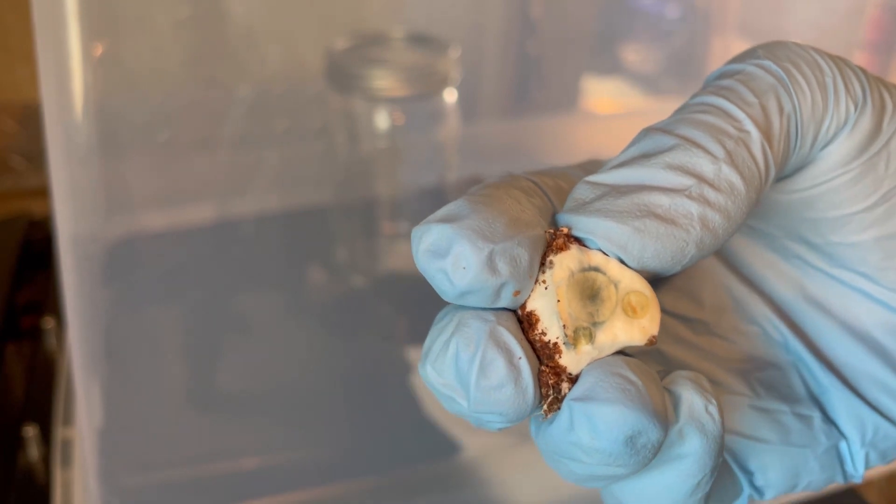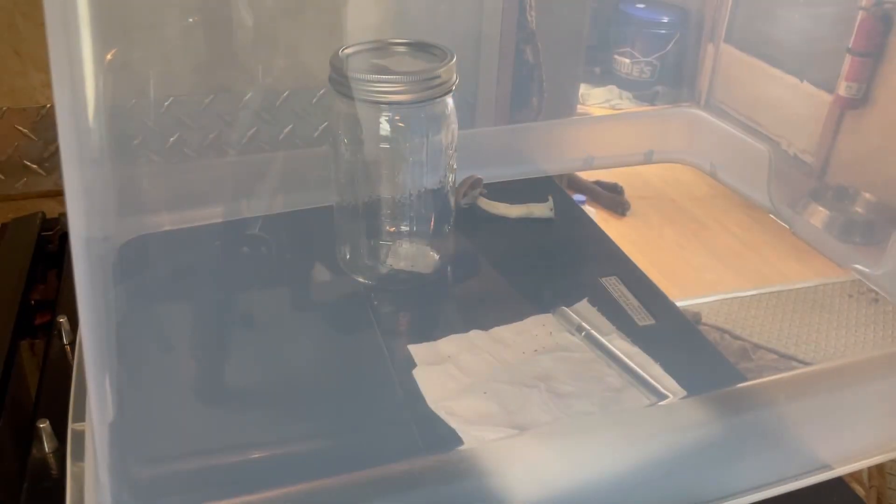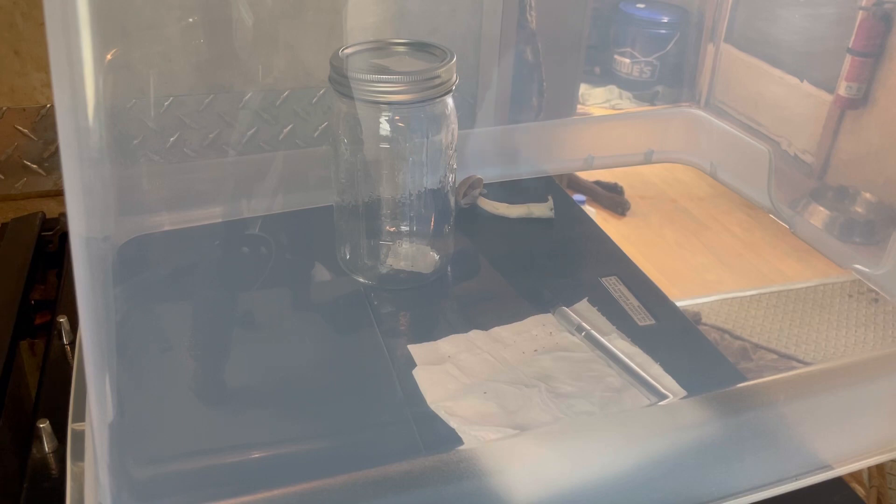Hope you enjoy watching that turn blue. That's what I do with it — then you take that jar with the corn and stick it in the incubation chamber, wait a couple weeks, and go from there. There'll be an actual video of me doing this in a week or so, so stay tuned. This little corn trick I've learned — taking the base of the mushroom and throwing it into corn to get mycelium back — I haven't seen that done.